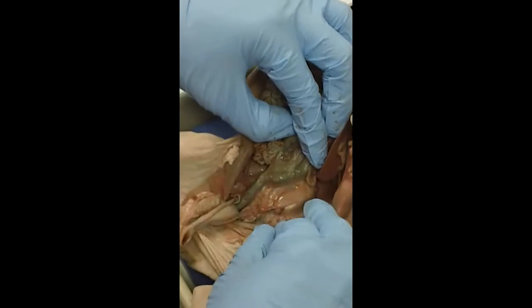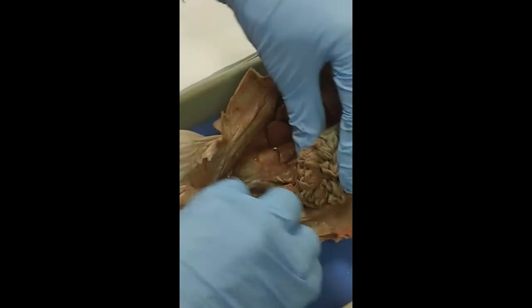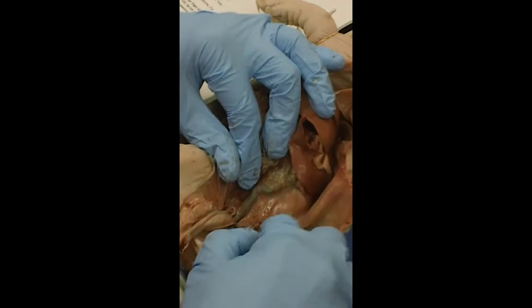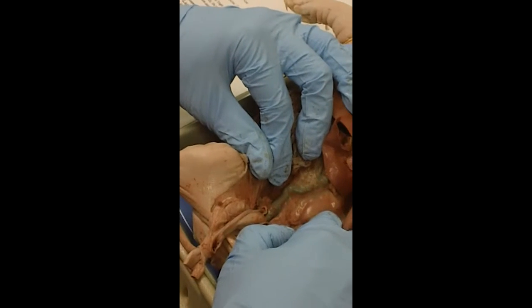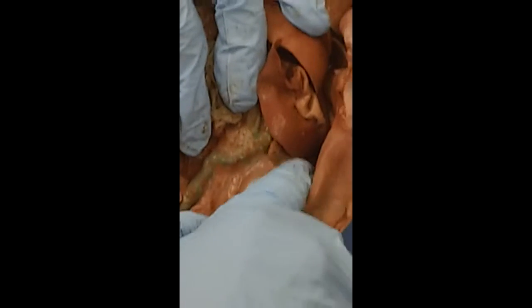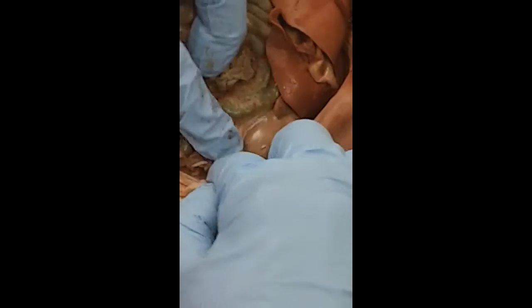Okay, also in the abdomen, let's move on to the excretory system. In the lower back on both the right and the left side, these lumps right here are kidneys. And kidneys remove the nitrogen waste from the blood from your cells' metabolism, and they mix it with salts. It's urea and salt and some water, and they turn it into urine, and then it travels down a tube.